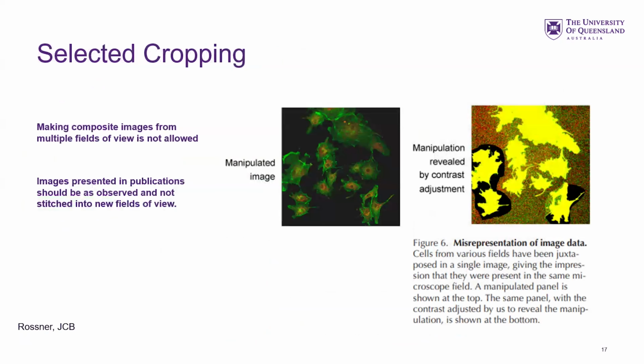This is a famous picture where these cells have been added to the field of view. So the composite image is being presented. This is from that 2006 paper. Most journals have tools that automatically blow out the signal and look for differences in background. So it's definitely not allowed to do that kind of thing.